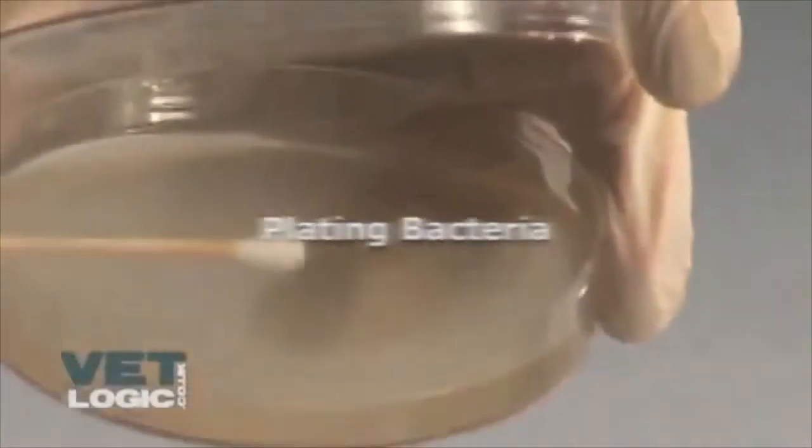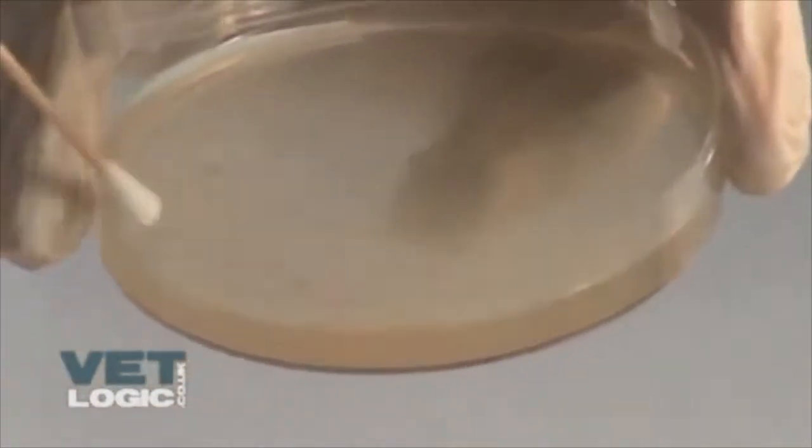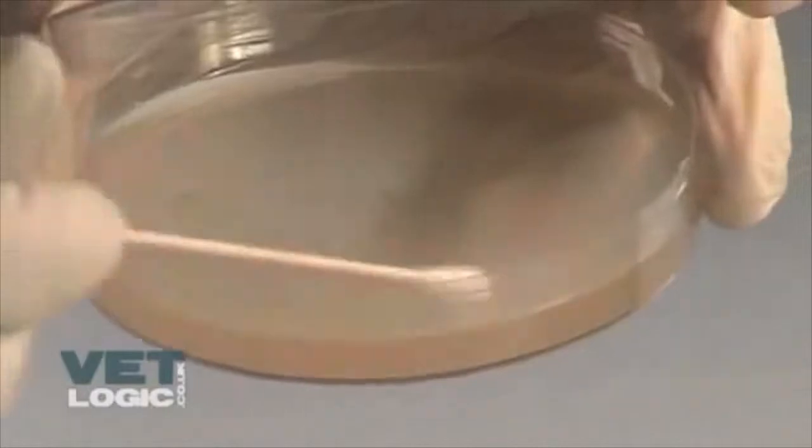Taking that bacterial swab, open the petri dish just enough to gain access. Wipe the swab onto the agar in order to make an inoculation well.